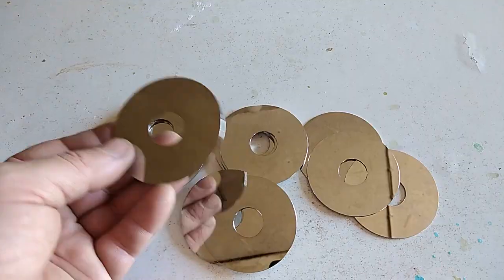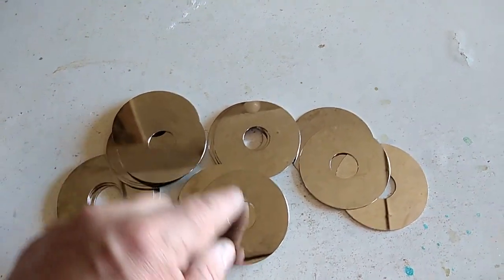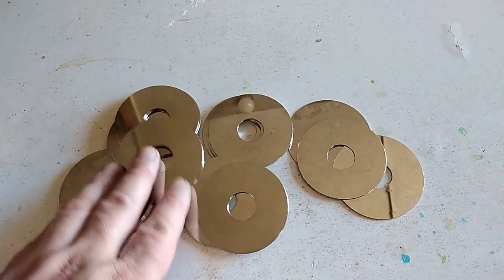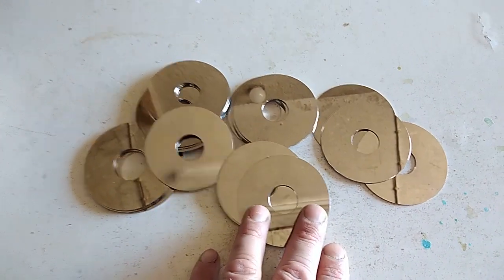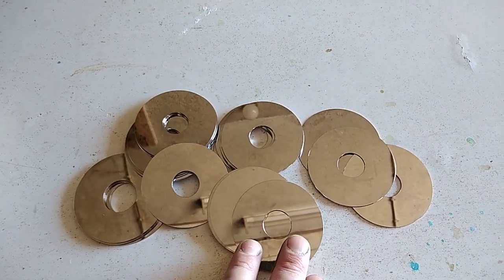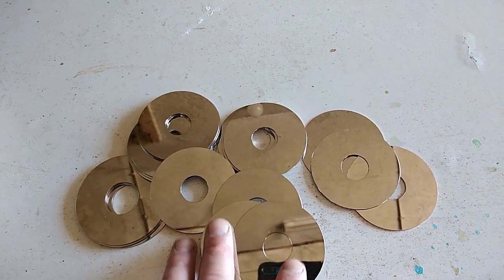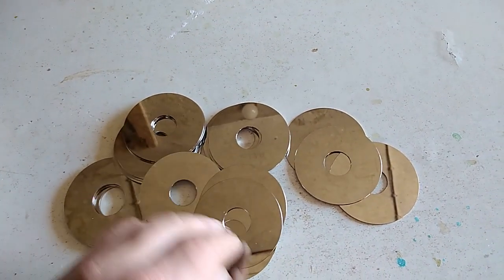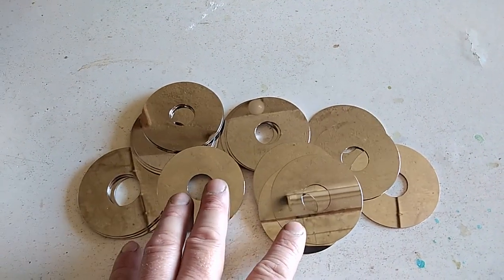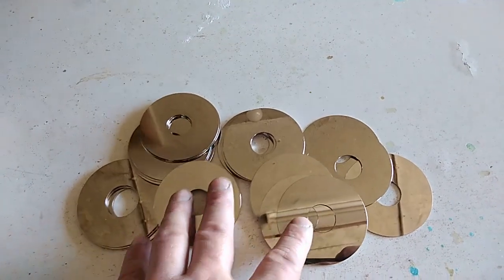But today here I have some laptop hard drives. And as you know, most of them are glass. So I'm going to see how many pieces I've got. These are laptop plates — this is the glass. So I'm going to break all that stuff, separate the aluminum one, and put that in a beaker.